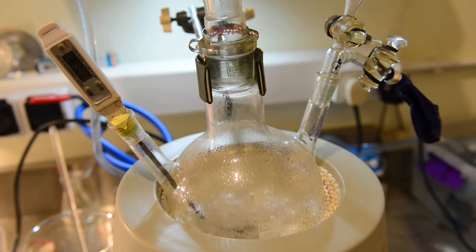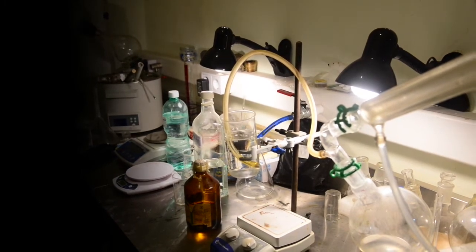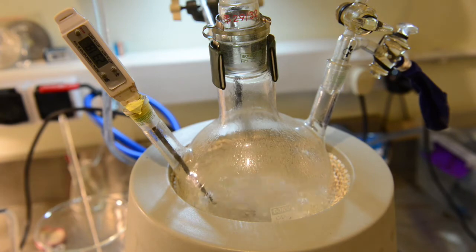Meanwhile, the temperature continues to rise. We have reached 226 degrees Celsius. The carbon dioxide evolution has increased and more distillate is coming over. We are getting closer to the desired temperature threshold.